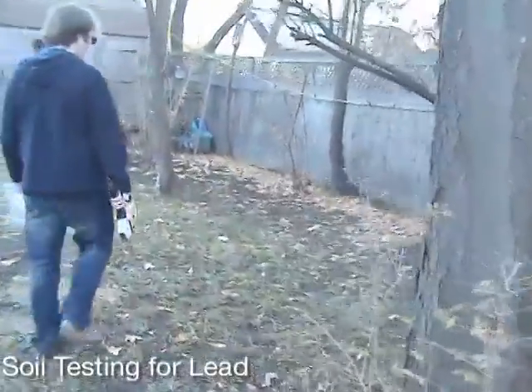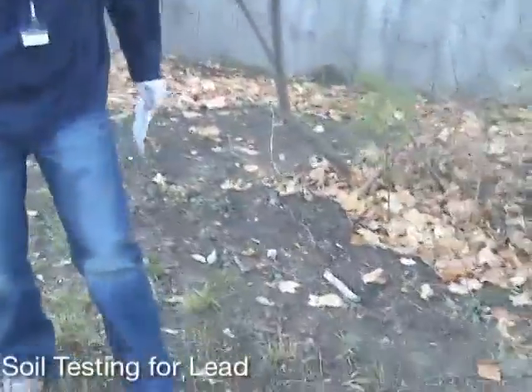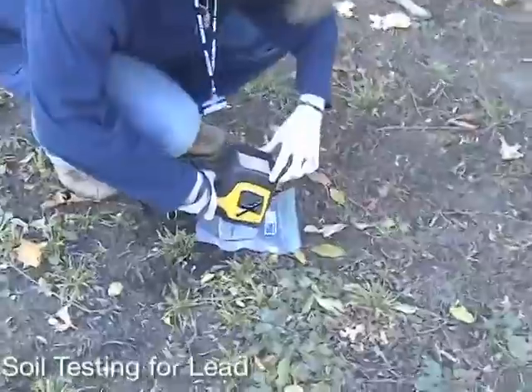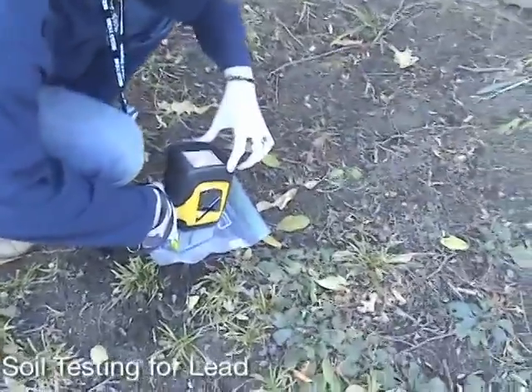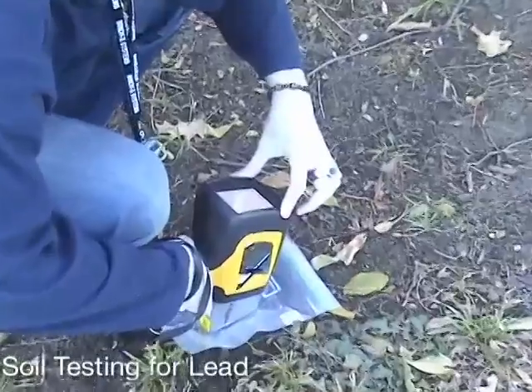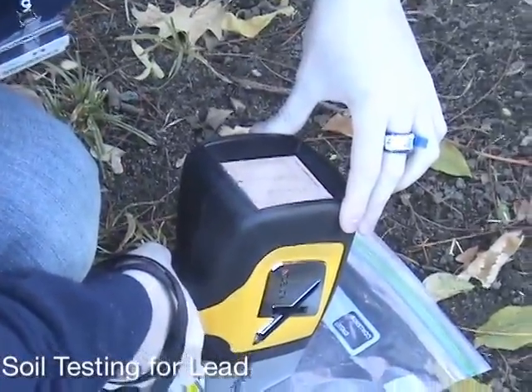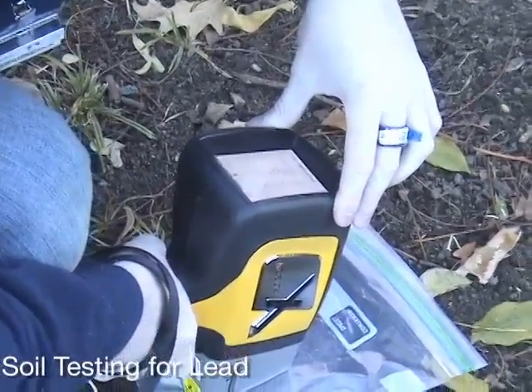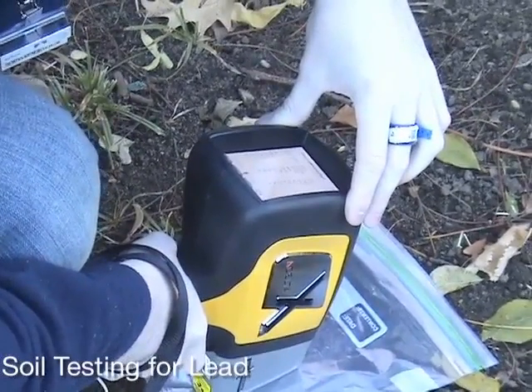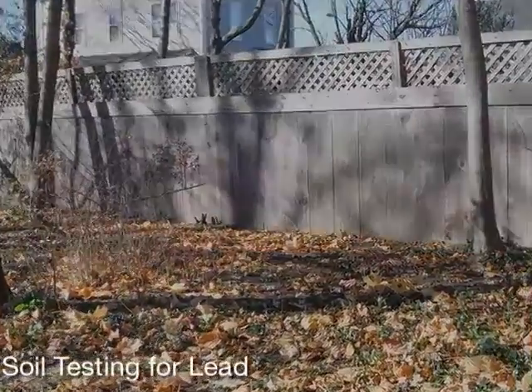The perimeter towards the back of the property looks like a good play area or a place to plant edibles. Leaves, weeds, and other debris need to be cleared to get a good reading of the surface soil. A plastic baggie should again be used between the analyzer window and the soil to prevent sample-to-sample transfer. The readings in the soil are about 250 parts per million lead, well within the 400 parts per million US EPA reference level, which would indicate that this may be the best place to plant edibles or let children play.